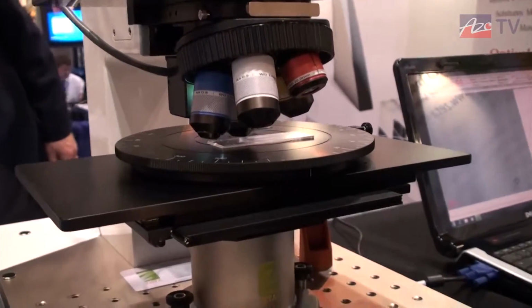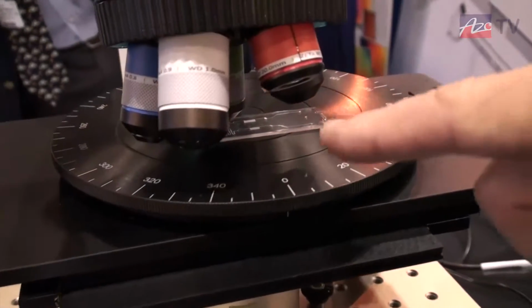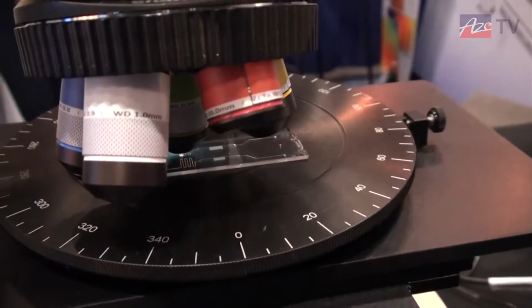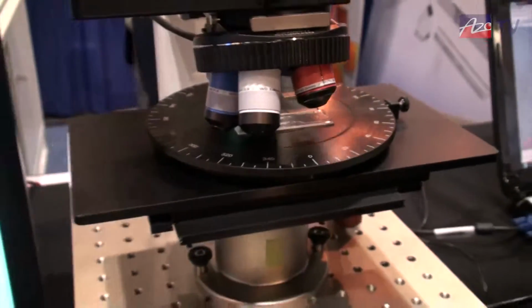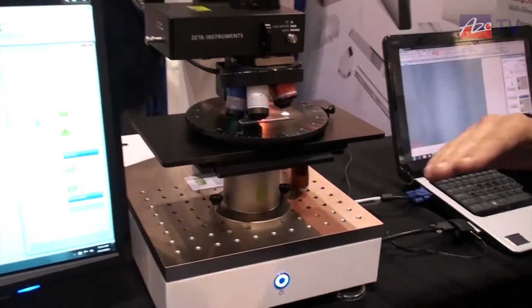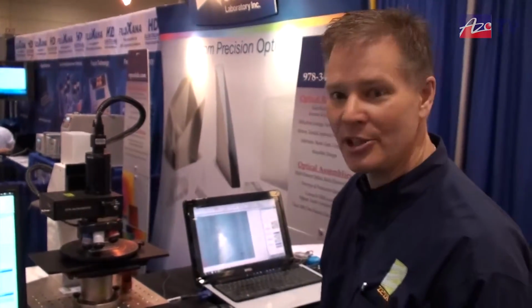in particular microfluidics devices and looking at multi-surfaces. The sample that I have on here is kind of like a lab on a chip, and it's located here on the stage. What I'm going to do is look at the different layers to be able to measure, even though it's sealed, the distance down to the bottom of the sample so that somebody can know what the height of the actual well or channel happens to be for their fluid dynamics, etc. So let's go ahead and do that measurement, Cameron.